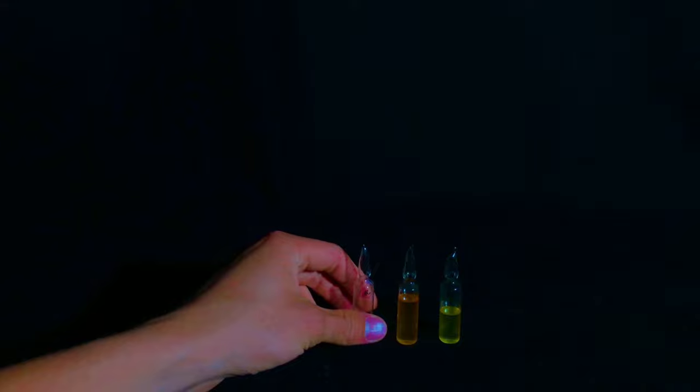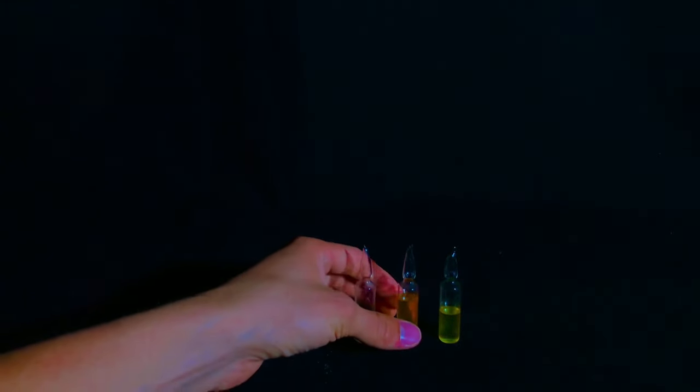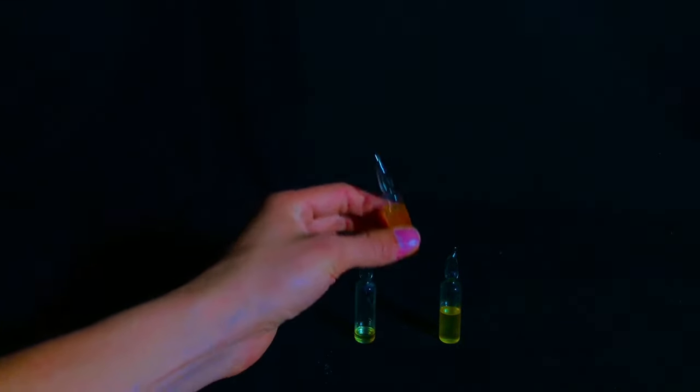In total, we collected 23.7 grams of phosphorus tribromide. This represents yields of around 61%. The yields might be increased significantly by continuing the distillation for a little longer.